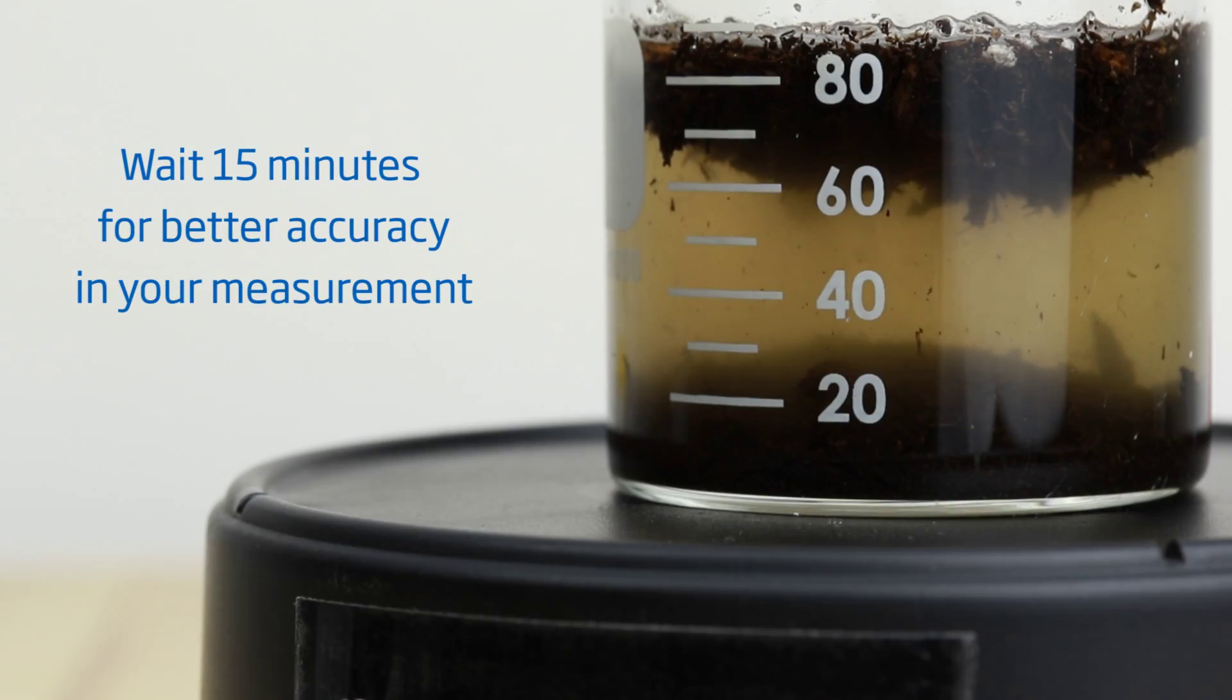Wait 15 minutes for the sample to settle before taking any measurement. It should look something like this.